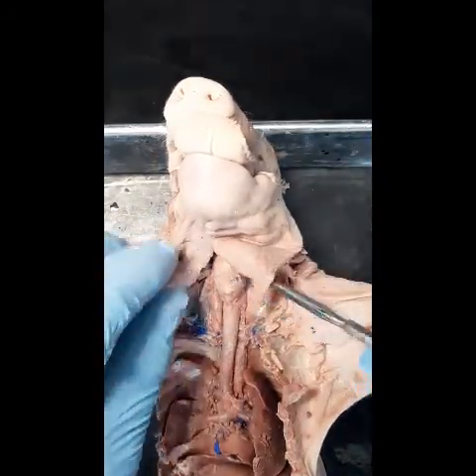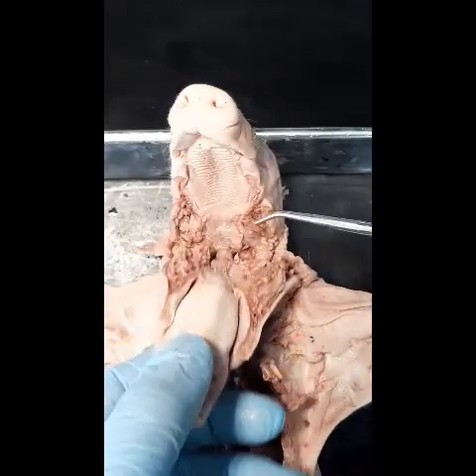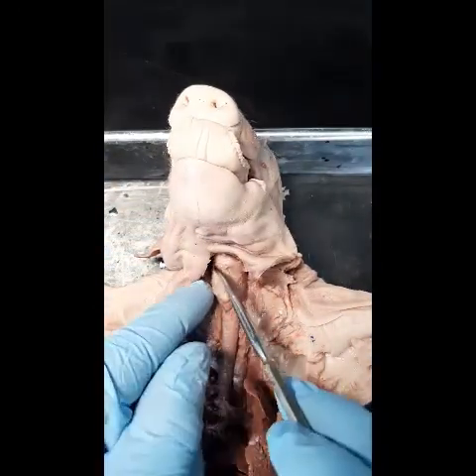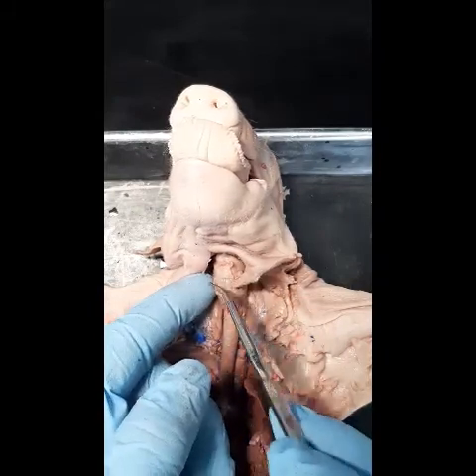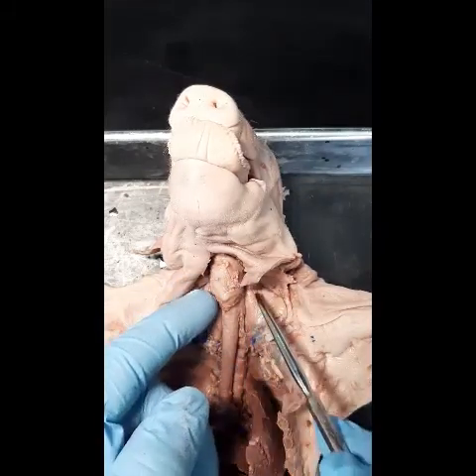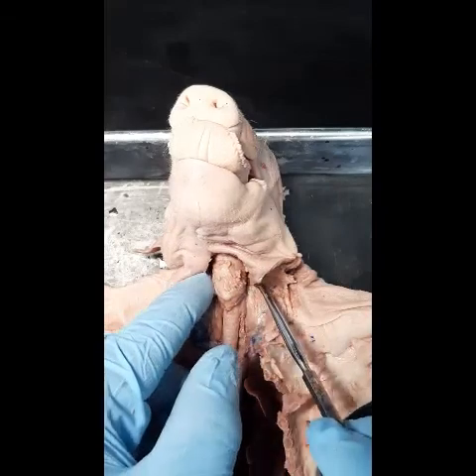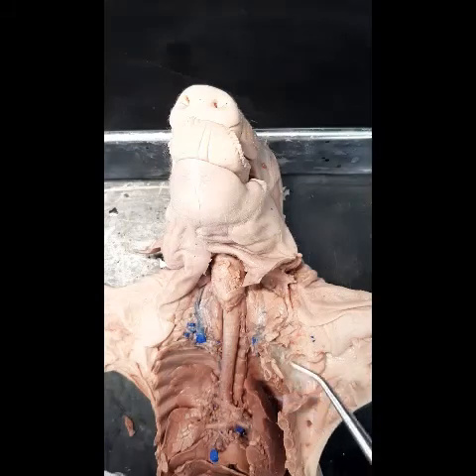Here is the larynx, and the larynx has nine cartilages. The epiglottis is the only one formed of elastic cartilage; all the other eight are hyaline cartilage. This is the thyroid cartilage, which is the largest cartilage of the larynx, also formed of hyaline cartilage. Inferiorly you have the cricoid cartilage, which forms a complete ring compared to the thyroid cartilage that forms only a partial ring.